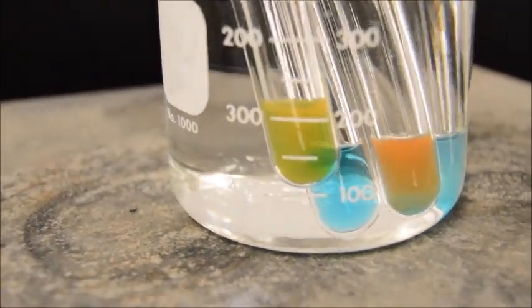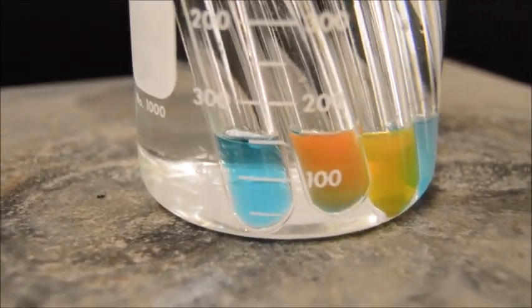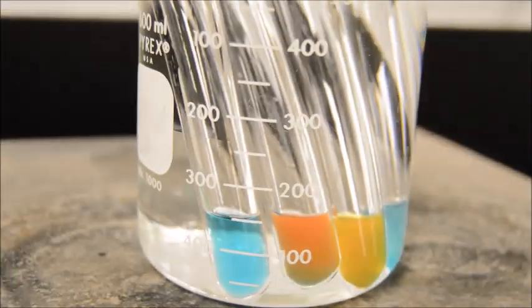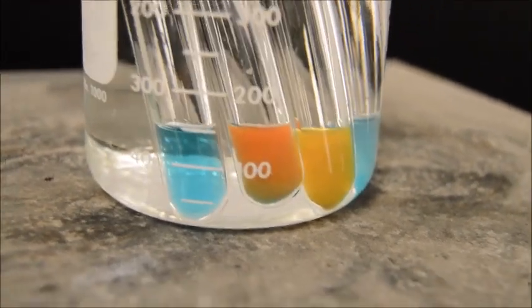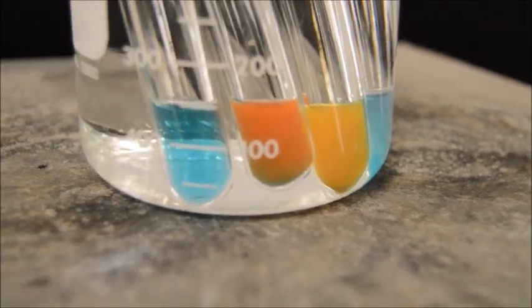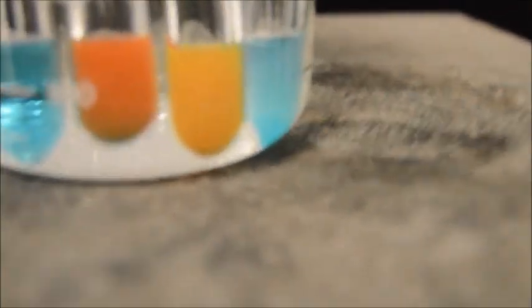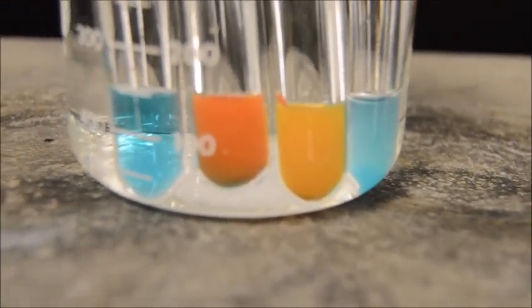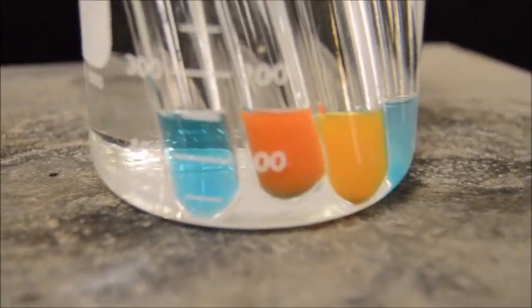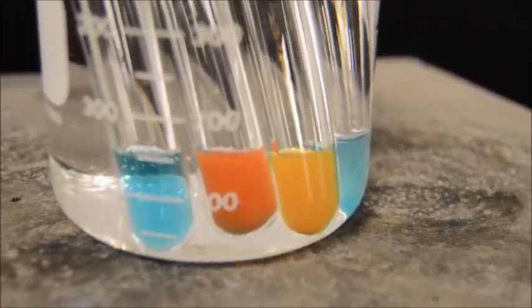And you can see on our little experimental here, number 2, which I believe is onion juice, it's also got a little bit of a shift occurring. So this did not happen without the boiling of these fluids, but with the boiling of them, or placing them in a warm solution, you might say, we're seeing an effect. This is a change based off of heating these up with the appropriate solution, and look how red that's turning now. That's amazing. An amazing alteration. Whereas our good old-fashioned distilled water here hasn't changed yet. Remember, it's our negative control, versus glucose, which was a positive control. Excellent.